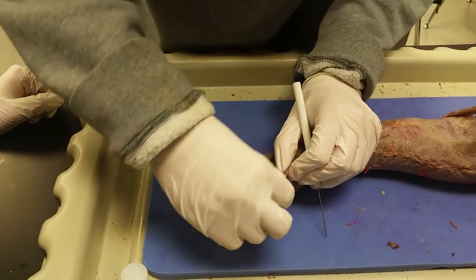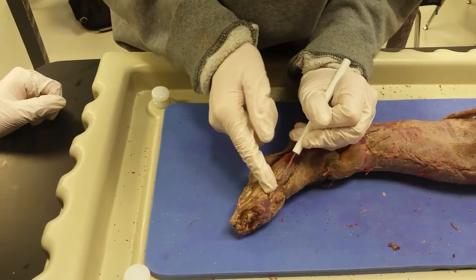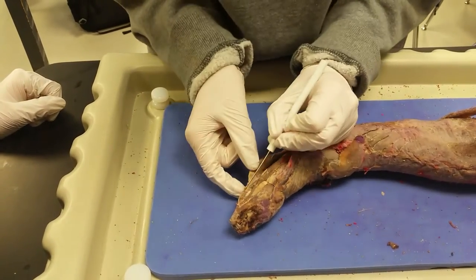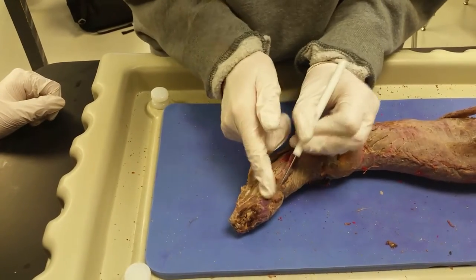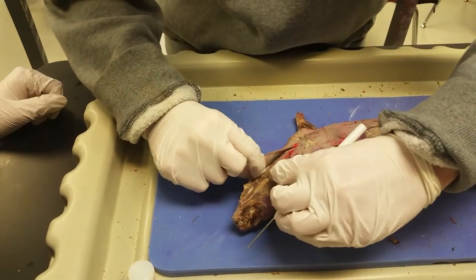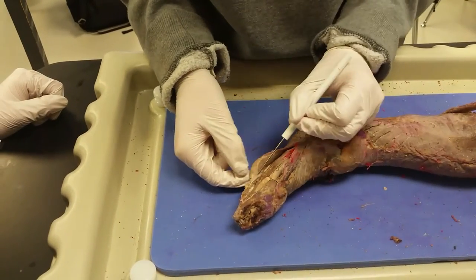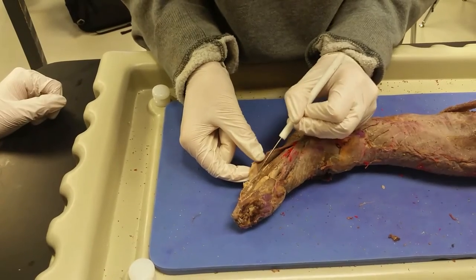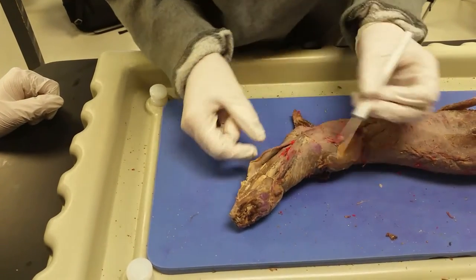Now we have two other glands to focus on. The small gland of the parotid gland — parotid on each side. Then, usually you'll see the mandibular glands right here, but our mink has one mandibular gland right here, and then one here abnormally.